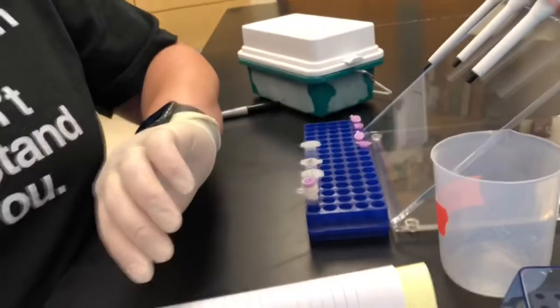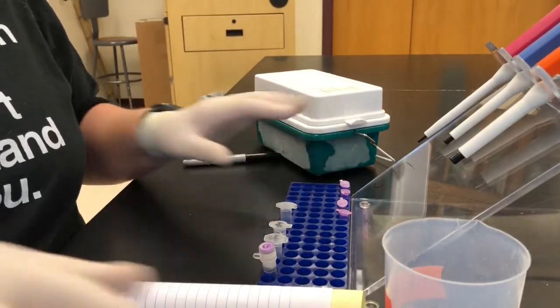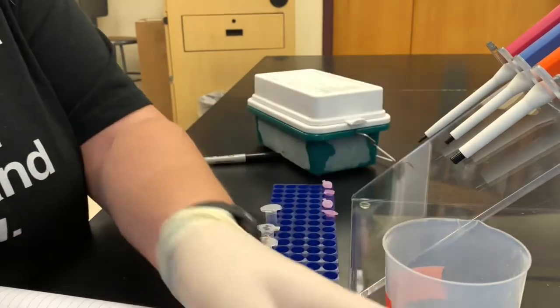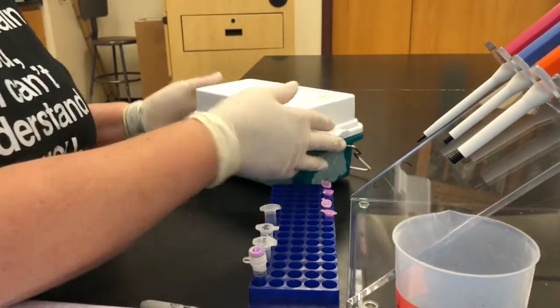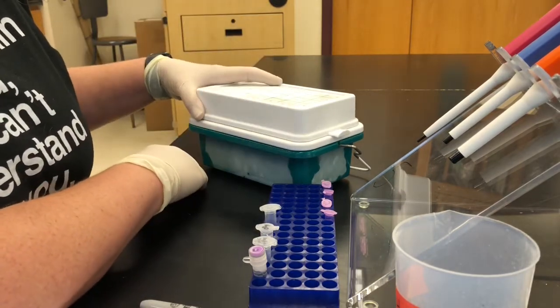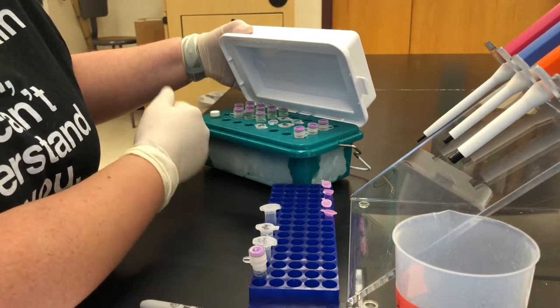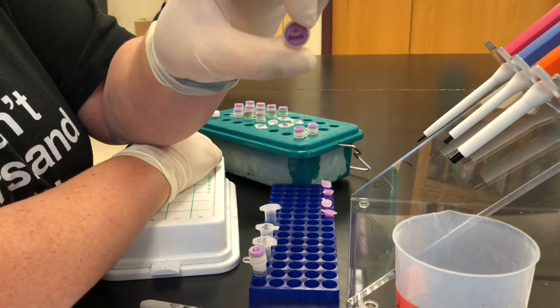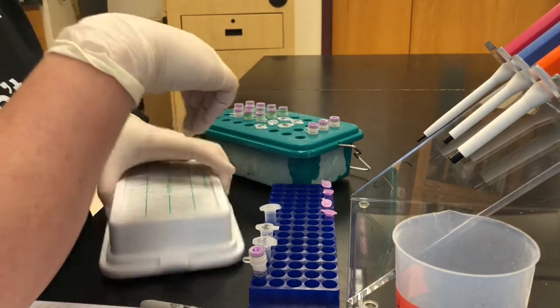I've got my little area set up here with my camera on a tripod. In my area I have my recipe, my tubes, my pipettes, my tips, my trash bucket, and my marker. I also have a cold container — basically a blue ice kind of thing you'd put in your freezer — to keep our specific restriction enzymes cold. We have some BamHI, some HindIII, and some EcoRI. Today I'm going to show you how to set up one of these reactions.